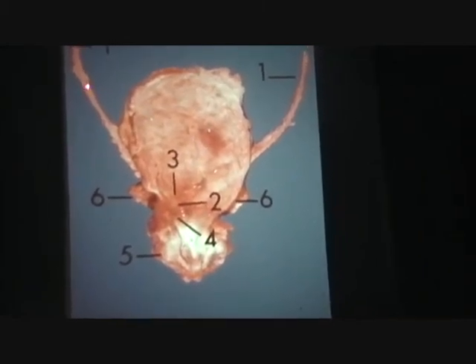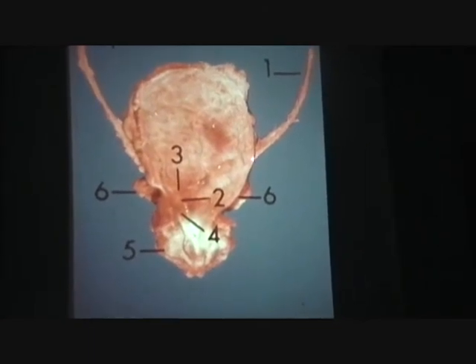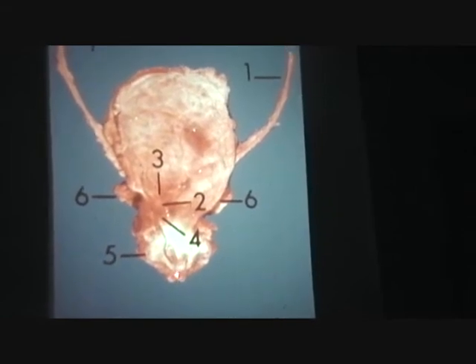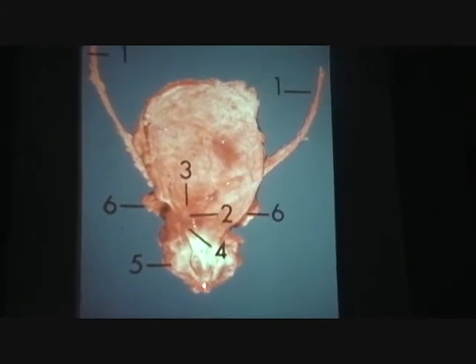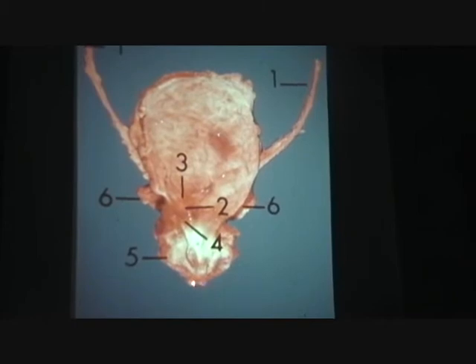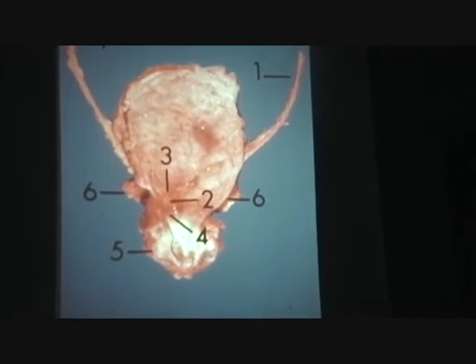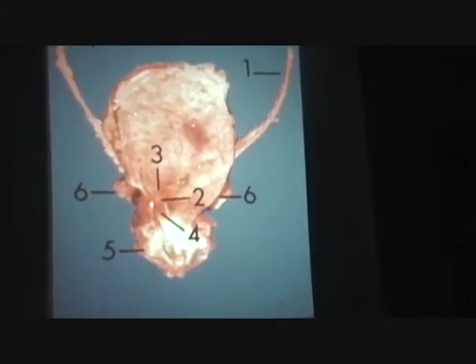So now you've got the right ureter, left ureter coming down underneath to the back. You then have coming out the base, right here, urethra. Yep. So here's the cutoff end of the urethra, which is encased in this glandular mass, prostate.